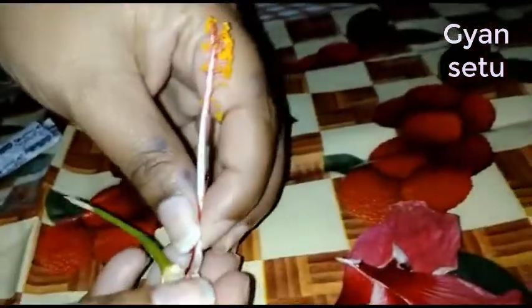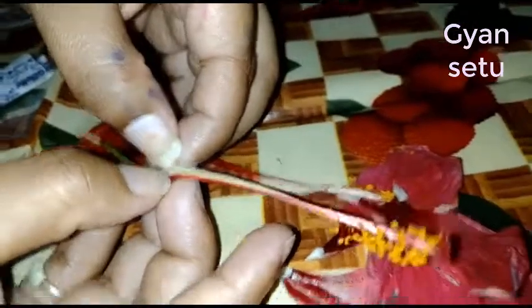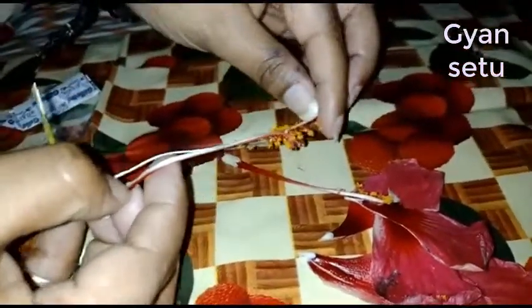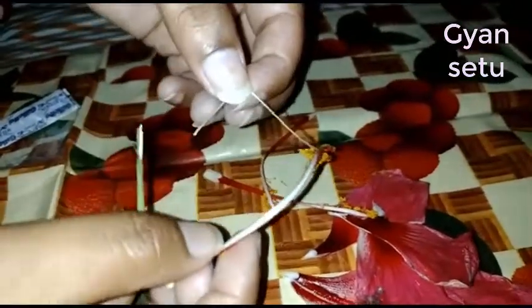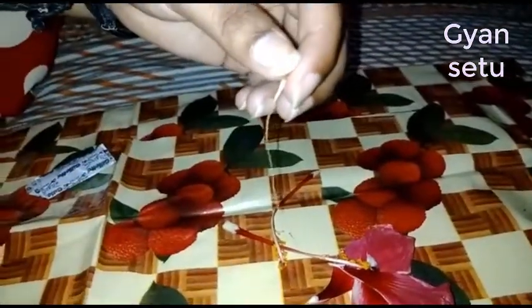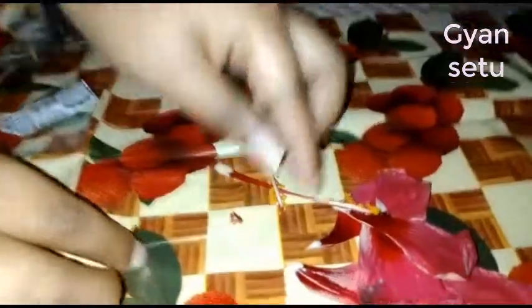You can see over here — this is your ovary. I have cut the anther, stigma, style, and ovary separately. This is simply your anther, you can see here.